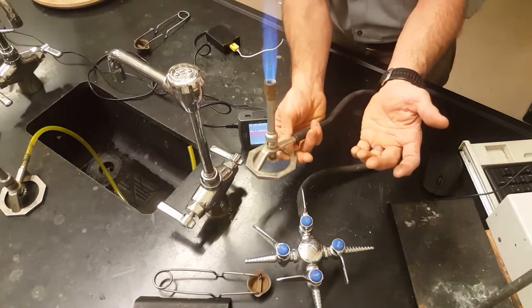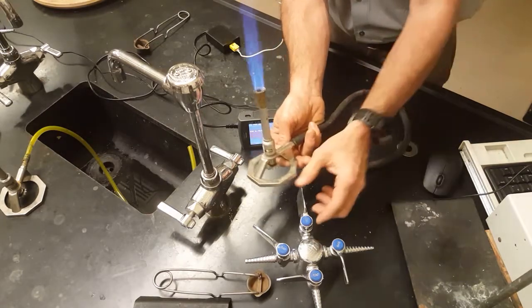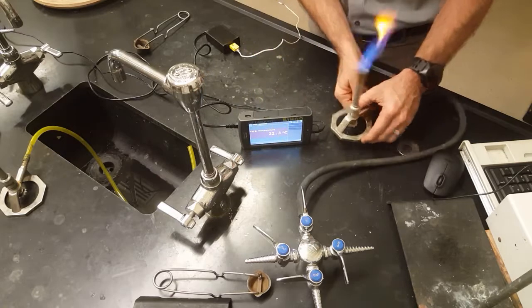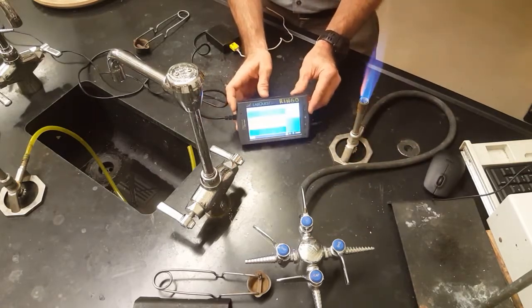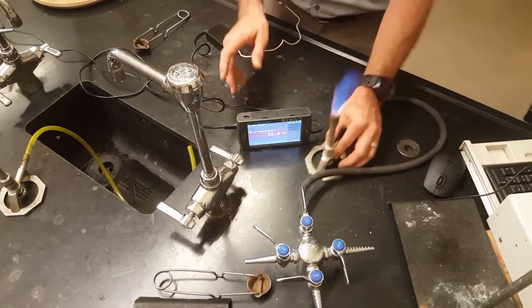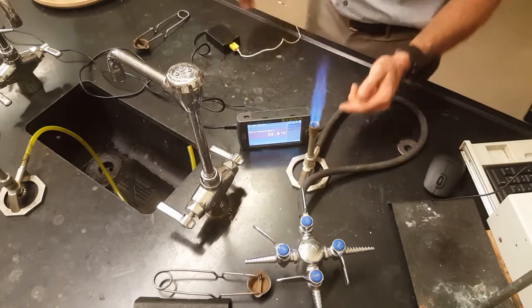Fantastic, look at that beautiful flame. Now the reason that we're using the lab quest today is so that you can find different temperatures at different locations in the flame.